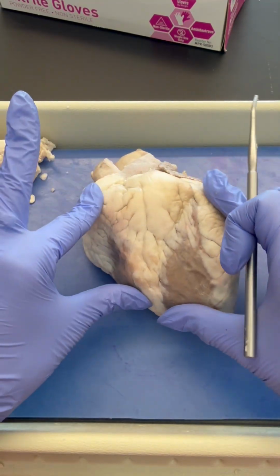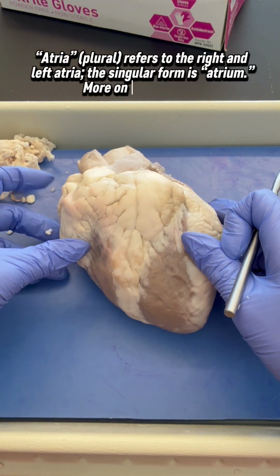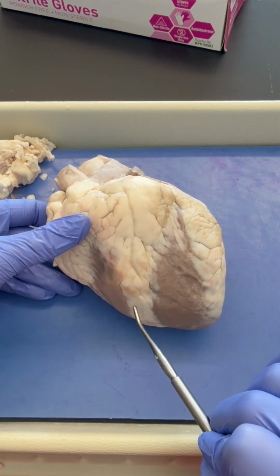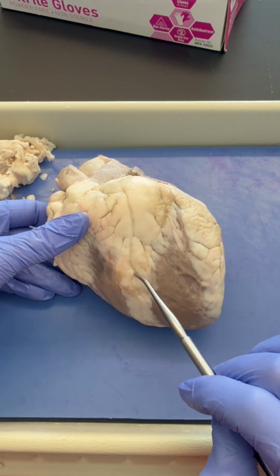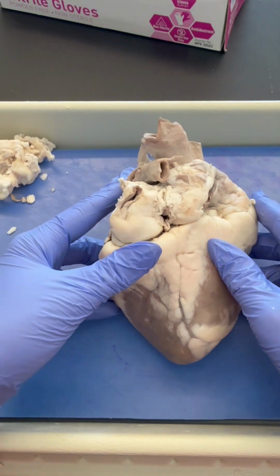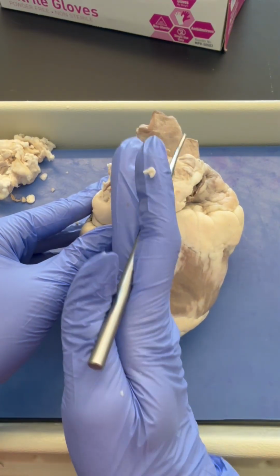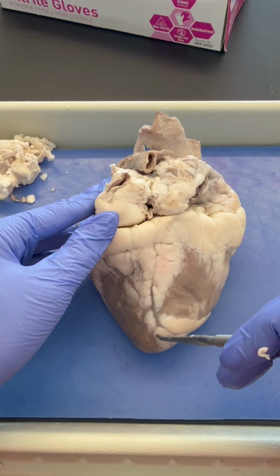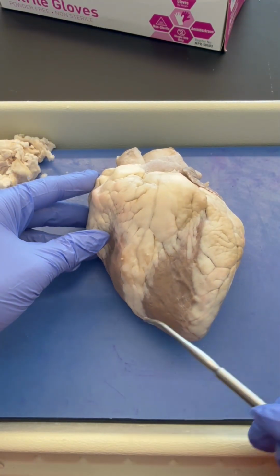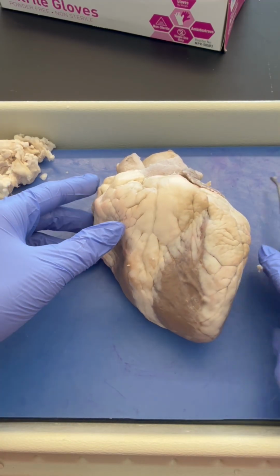Notice that the ventricles are making up the bulk of the mass of the heart, whereas the atria are comparatively much smaller. The interventricular sulcus is covered with fat, but of course we have some important blood vessels underneath all of that fat. On the posterior surface of the heart, the interventricular sulcus is much more vertical between these ventricles. So that's the biggest clue. On the anterior surface, it runs diagonally, especially look at the apex to help you know that it's diagonal there.